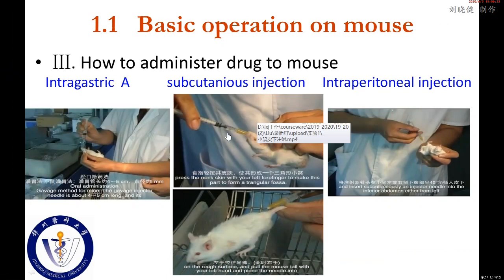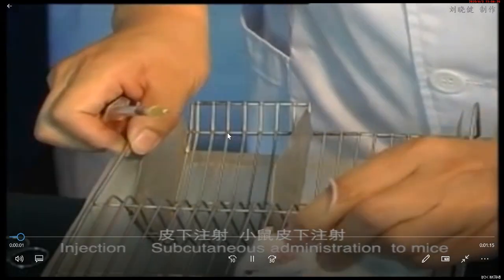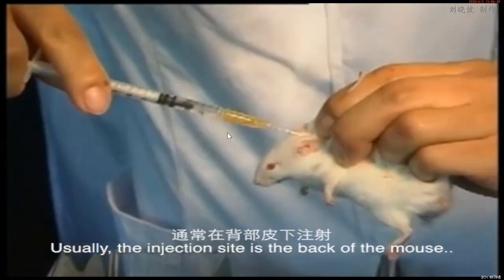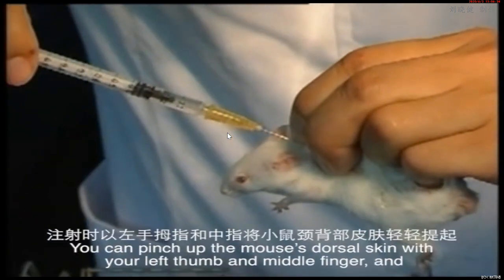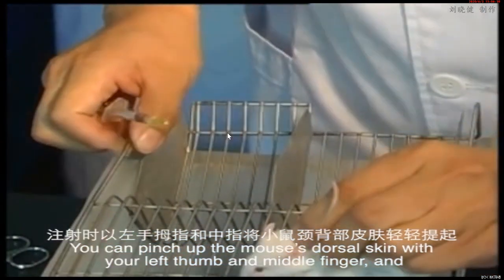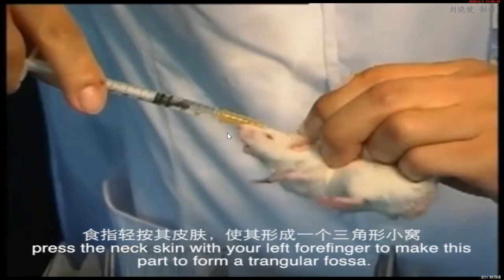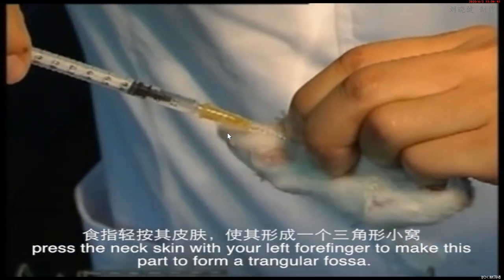Okay, subcutaneous injection. Subcutaneous administration to mice. Usually, the injection site is the back of the mouse. You can pinch up the mouse's dorsal skin with your left thumb and middle finger, and press the neck skin with your left forefinger to make this part form a triangular fossa.